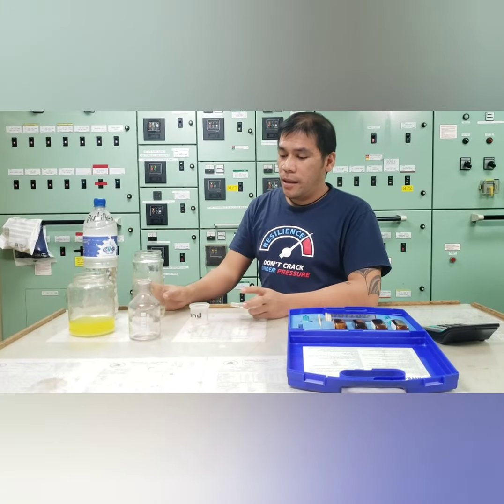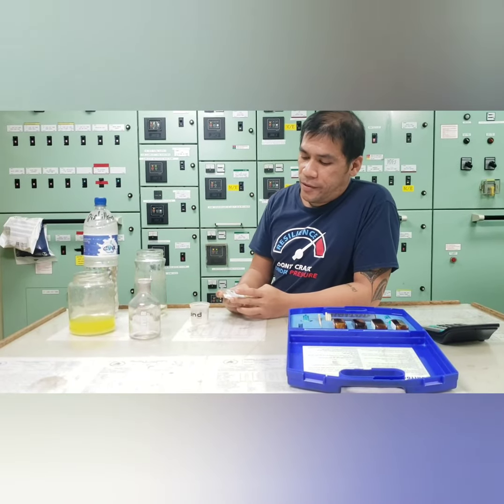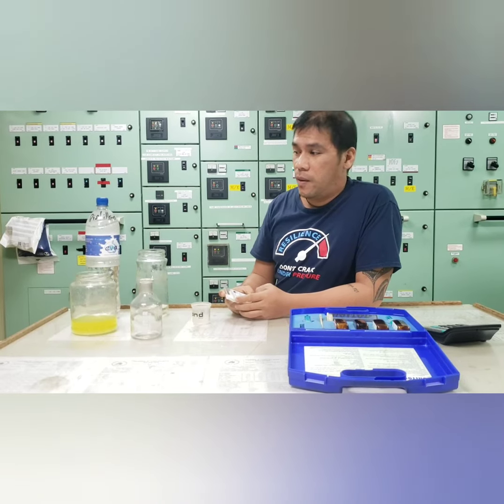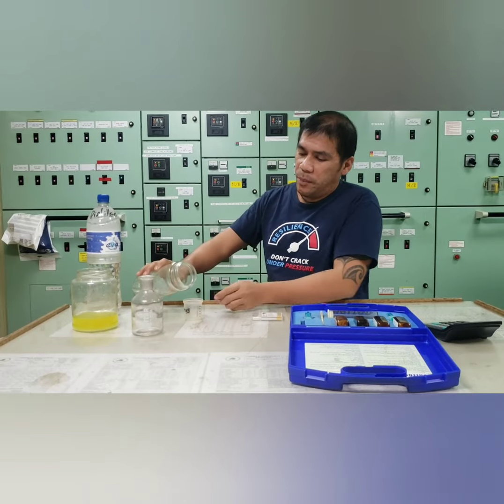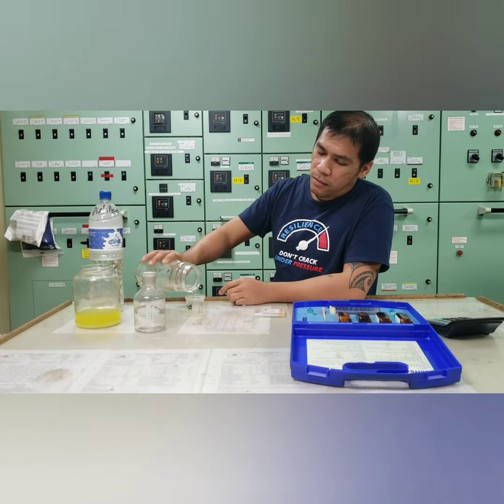Okay. Another test we're going to take is for the pH value of our cooling water system. So another, we will going to put another 50 ml of our sample.